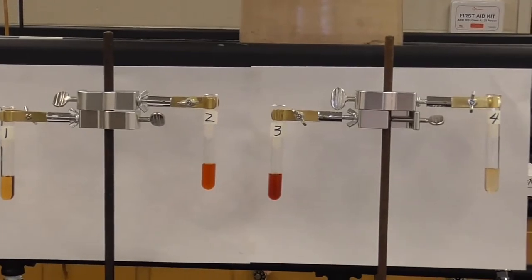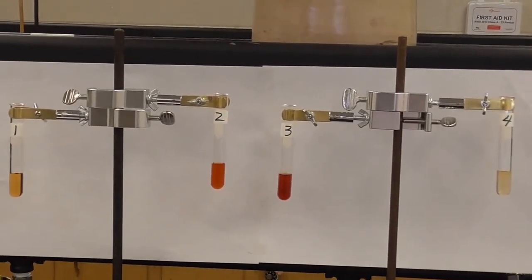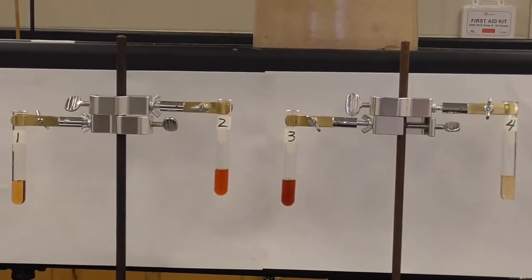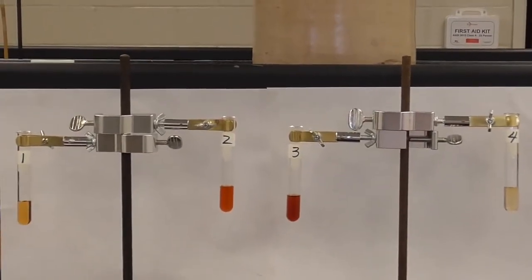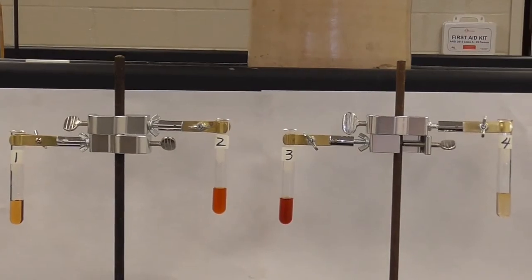As you think about what you're seeing, again, LeChatelier is what we are investigating. So think about which way it caused that equilibrium, or in this case, the two equilibriums, to shift. Okay, part D, our final equilibrium. We're going to look at how temperature can actually affect the equilibrium. Let's go to the board.